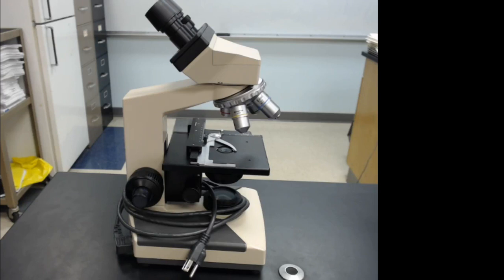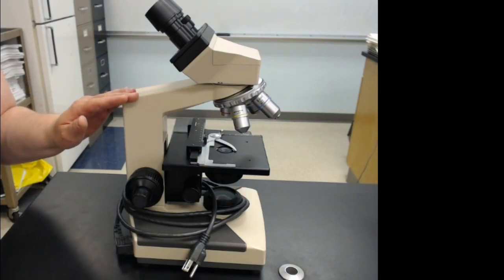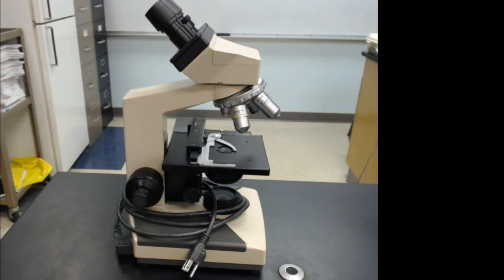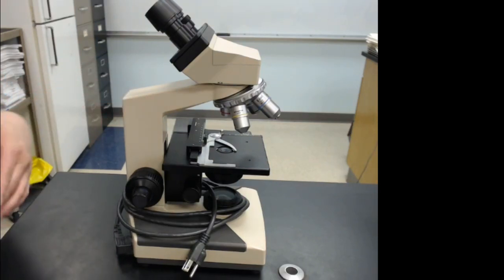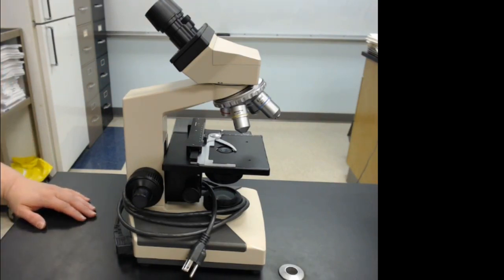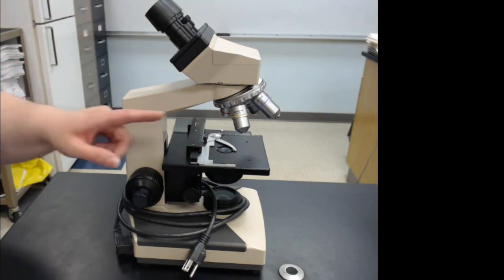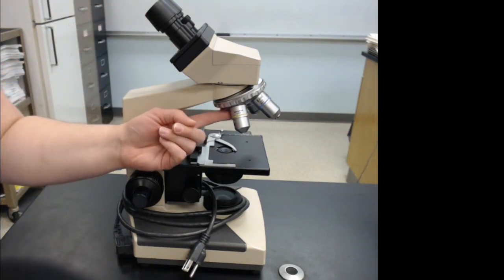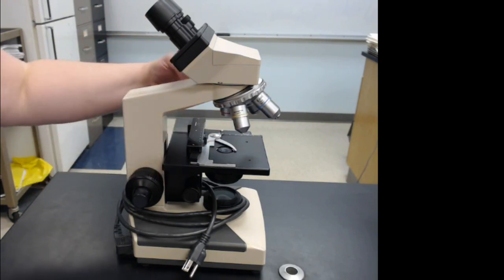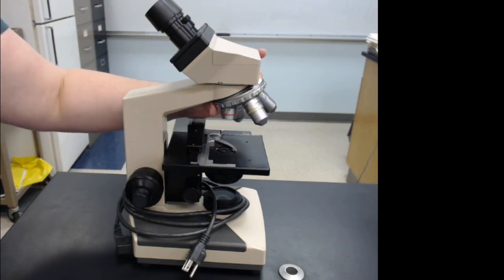This is a compound light microscope. It's called compound because there are multiple lenses you look through to view your specimens. These are the oculars, and you have the objectives — there should be four on each microscope.